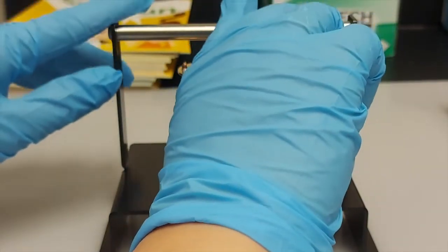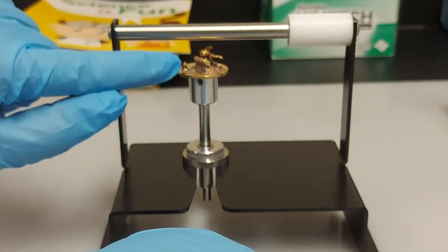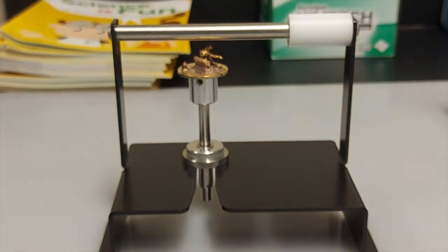Once you're confident that the gap becomes 8 to 10 millimeters and no part of the sample touches the stage bar, now you're ready to put the sample in the microscope.